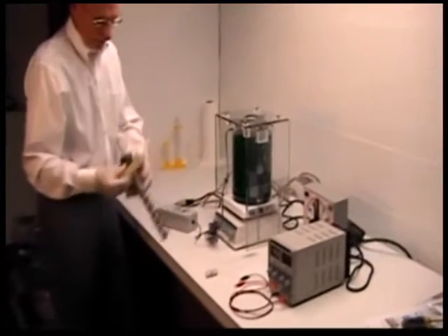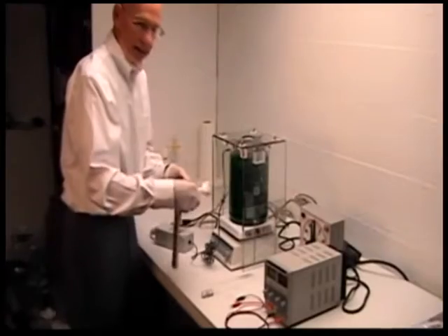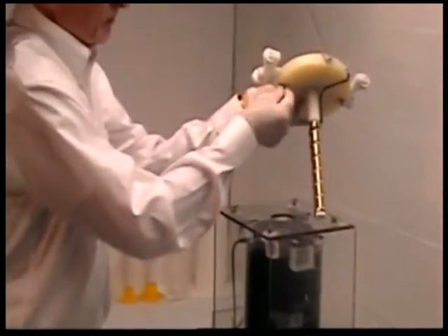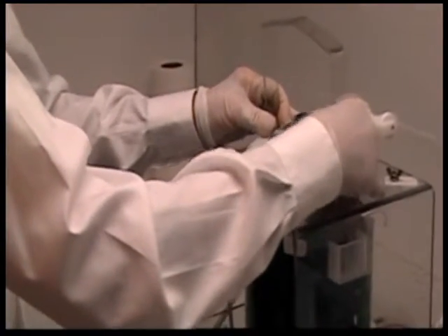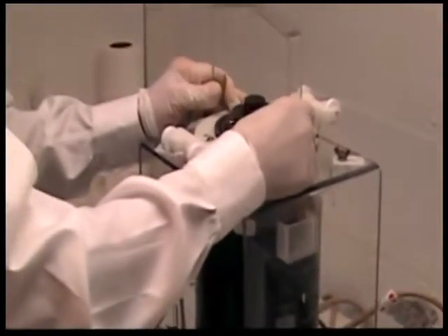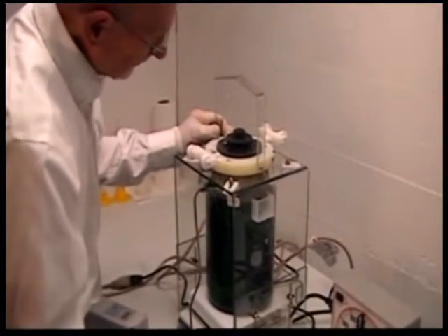The helix is on the spiral contractometer. I'm going to mount the spiral contractometer with the contact to my right in the rear. Simply drop this down. You'll note that this has two places that engage holes in the top of the stand to center it. One of the problems with the prior system is that you couldn't get proper centering. It's important to have proper centering and uniform plating around the spiral.